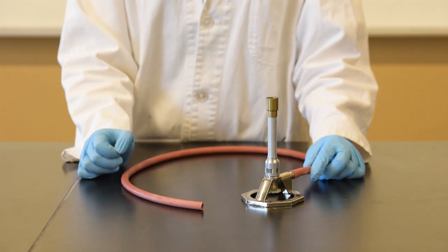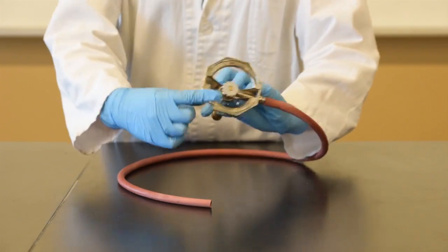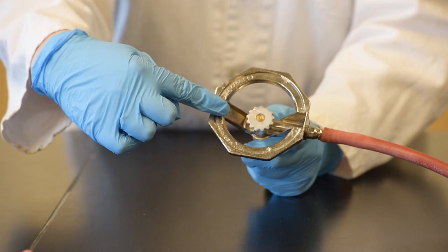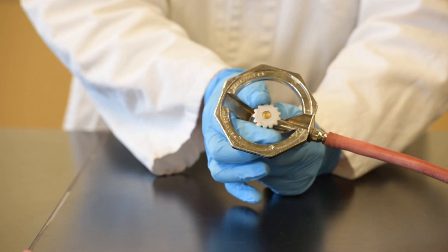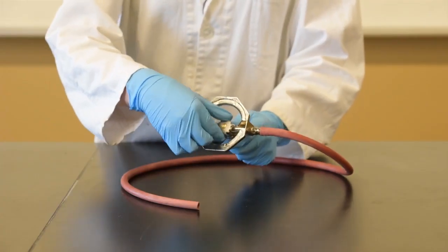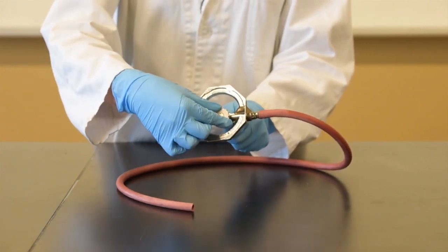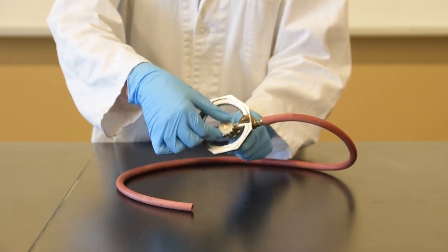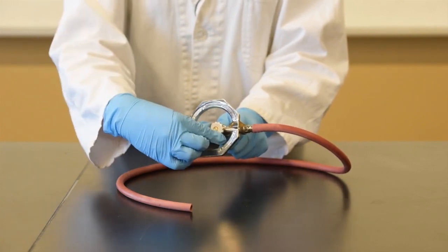There are two main dials or valves on the Bunsen burner that you should be familiar with. There's one on the bottom and there's a big one on the top here. The one on the bottom is going to be your propane flow control dial. It follows the rule righty-tighty, lefty-loosey. So even though it can open very far, just less than a quarter turn is more than sufficient to get enough propane flowing for your combustion. So that orientation is closed, and a quarter turn gets enough propane flowing.